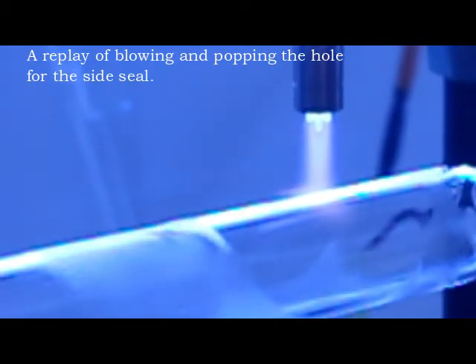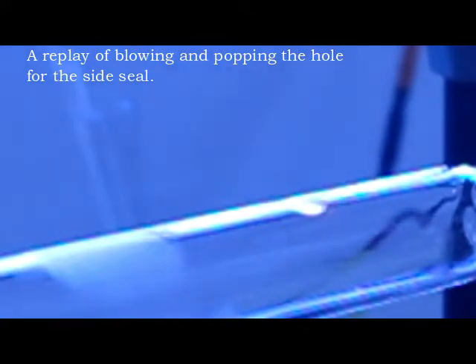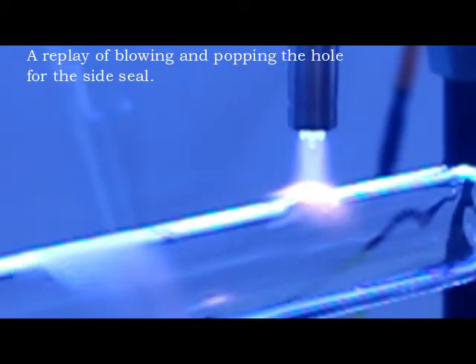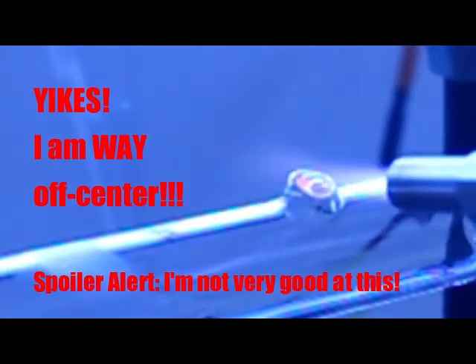Again I'm a chemistry professor not a scientific glass blower, so making mistakes is actually something I'm very good at and have lots and lots of experience in doing that. So here I am showing popping that hole again, zooming in on it so you can see. There are many glass blowing videos on YouTube that are absolutely excellent, unfortunately not as many of them are focused on scientific glass blowing which is one of the reasons why I wanted to make this. And here we go, pop, and you can see I'm off-center.